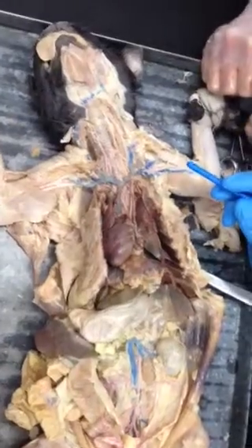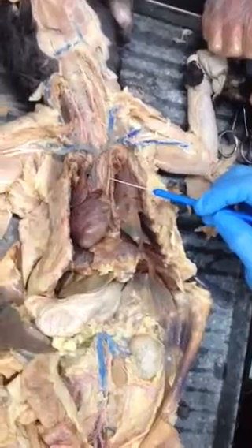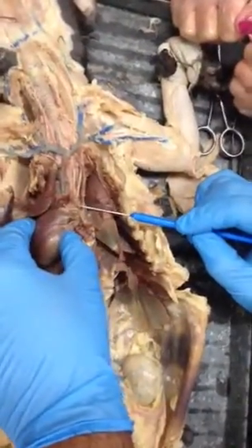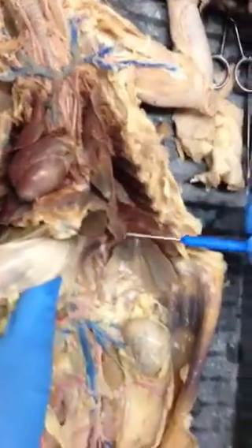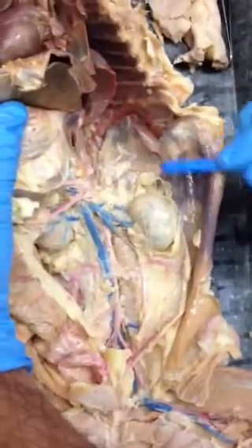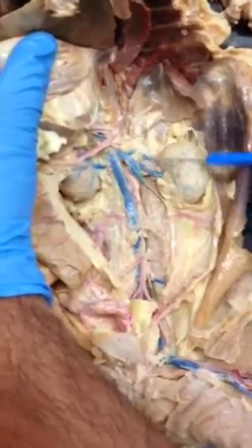All of the arteries for the cat. The first thing that you need to know on your sheet is the aorta and the descending aorta. As we talked about before, this is the aortic arch. Anything from this point down, heading down this way, in the back here, running down here, continuing down, the red, up until this point, is all descending aorta.